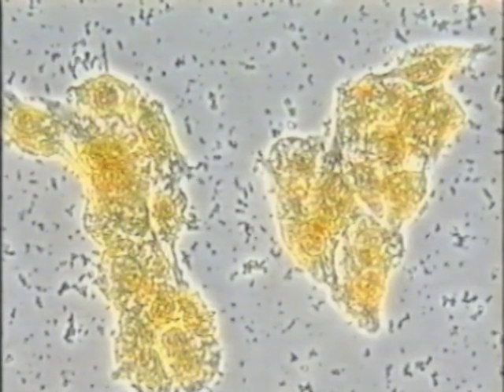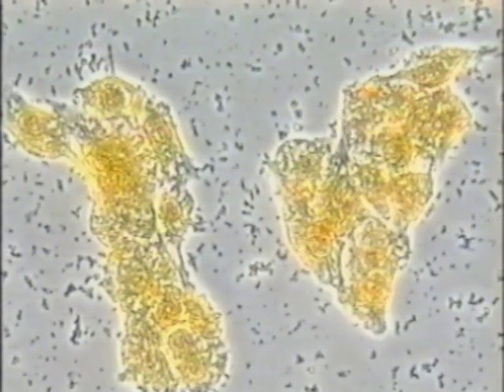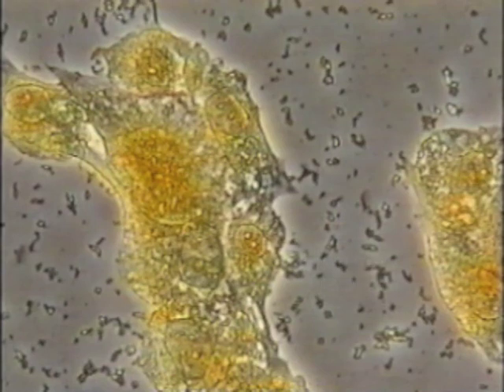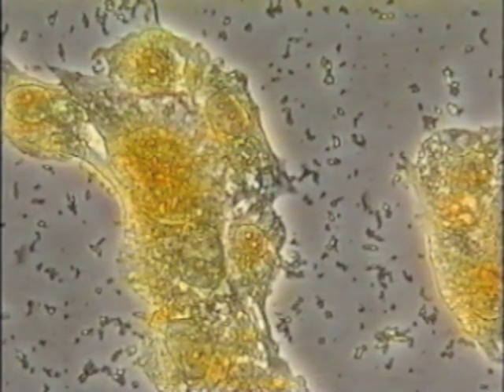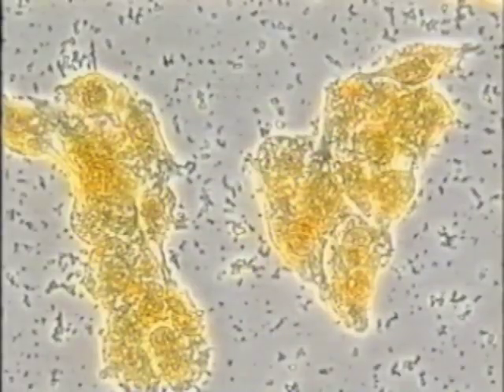Here we see once more glioblastoma cells, 19 hours after we started the experiment. The color of PB100, increasingly bright, is now orange, while fluorescence decreases. Glioblastoma cell destruction continues. Cytoplasm falls to pieces. The nuclear membrane becomes yellow. Still no changes have occurred in normal astrocytes. Following 24 hours in the presence of PB100, cancer cells have been destroyed. Their cytoplasmic membrane has disappeared and cytoplasm has disintegrated.